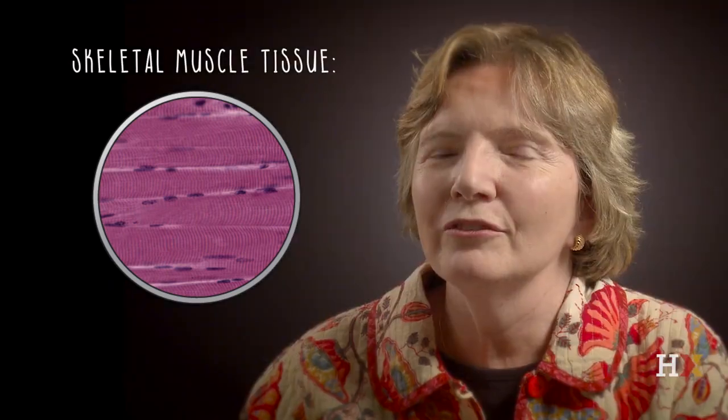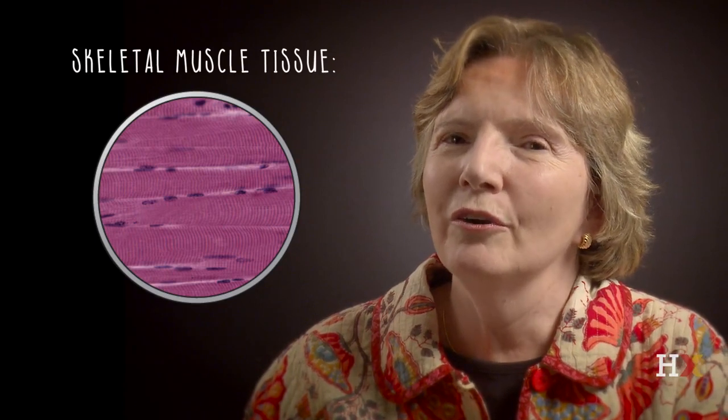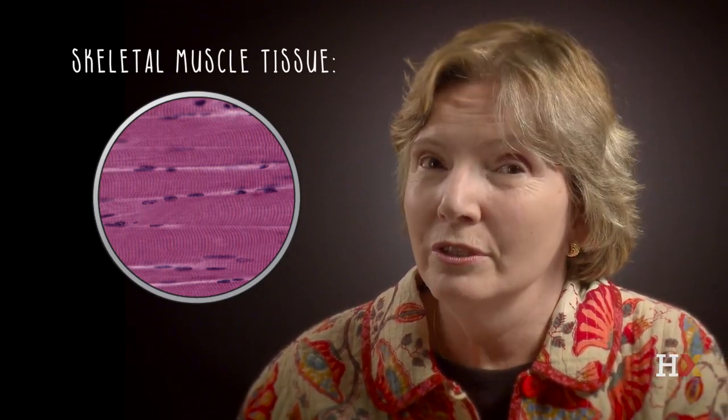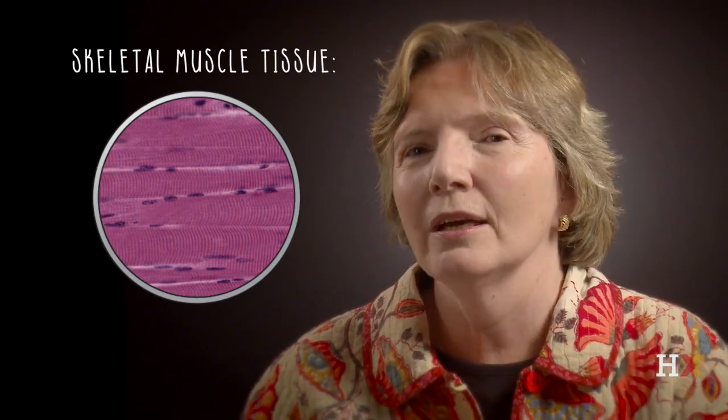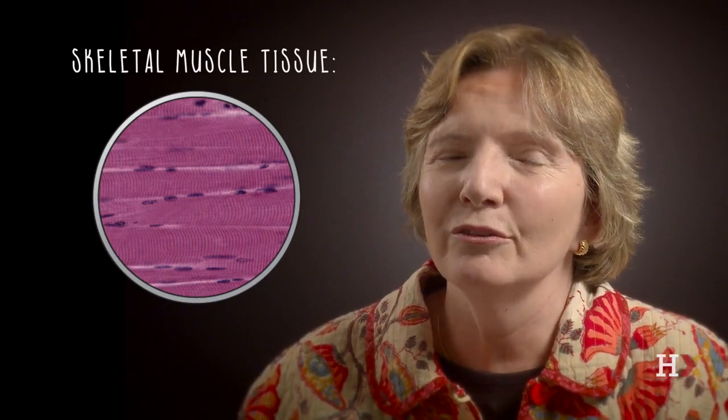Look at this slide again and see if you can figure out which are the cells and which are the nuclei. This is an example of skeletal muscle tissue, and the cells in skeletal muscle tissue are actually collections of a number of smaller cells that fused during development. So an individual muscle cell will be multinucleated. There will be a number of nuclei in it, and those represent the nuclei of the fused cells.